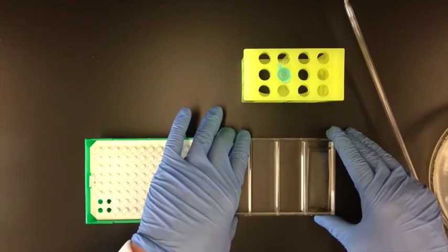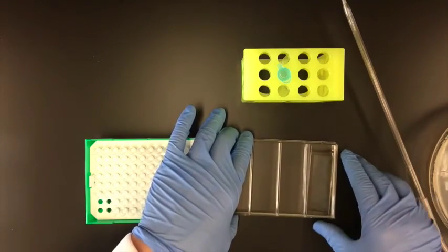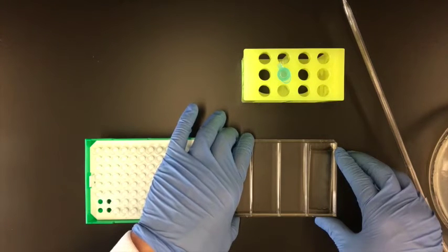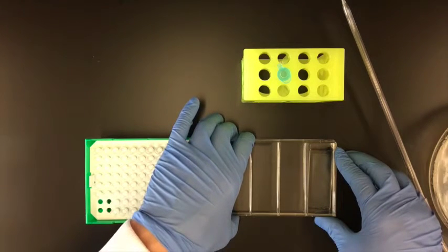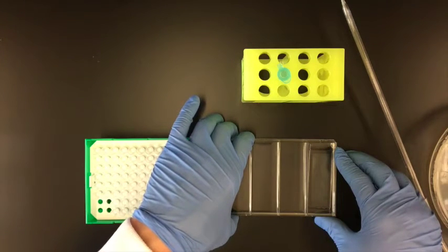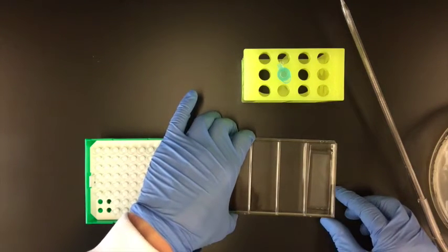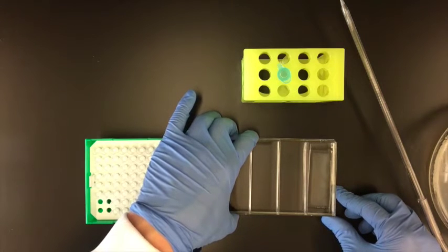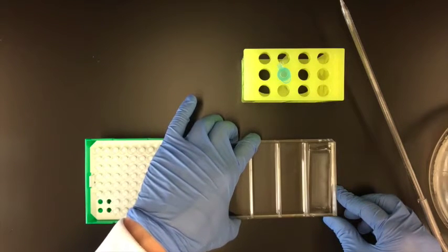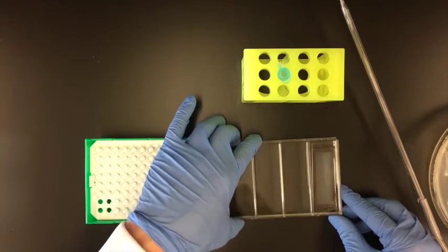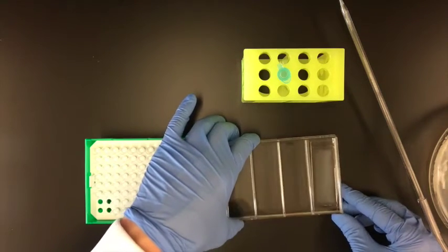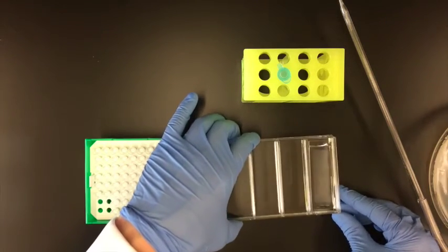So we want to allow some of the beads. I'm lifting up the left edge of the dish right now, no more than 5 or 10 degrees. But that is letting the beads collect to the right side, which I hope you can see on the video. And so what that's going to allow me to do is slowly collect the beads on the right side of the device.